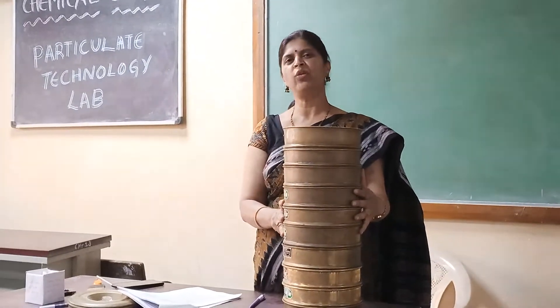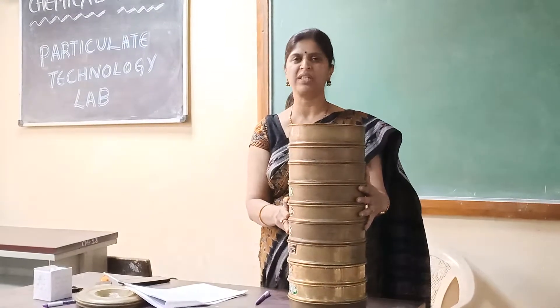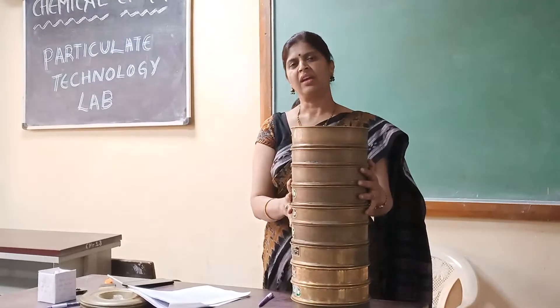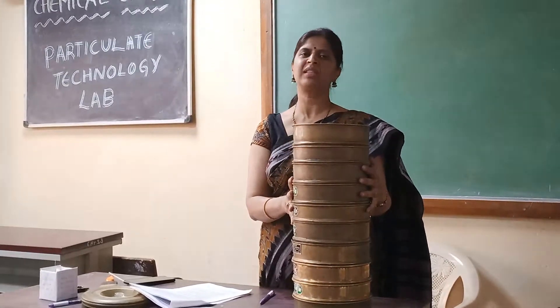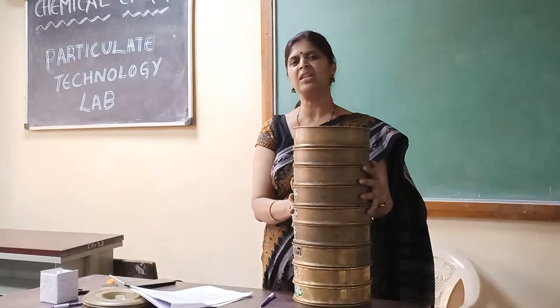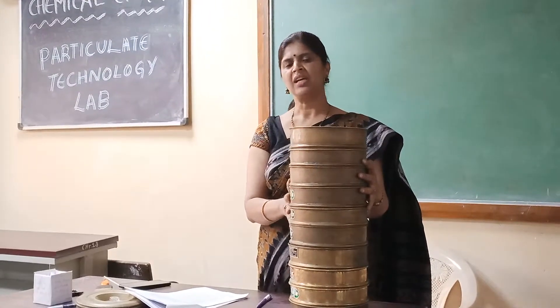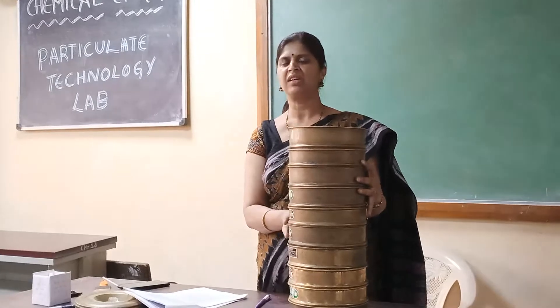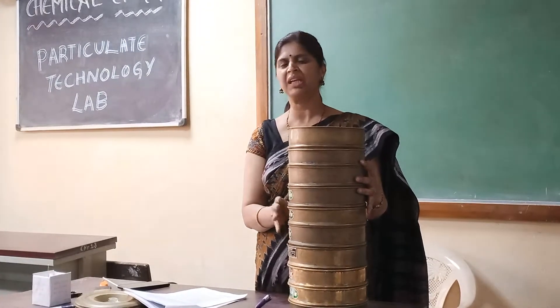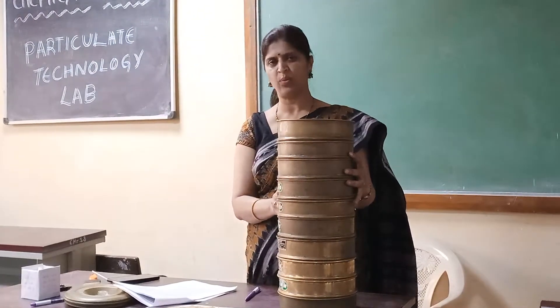You already know from the last session of screen analysis what screen analysis is and what a screen is. The screen is used to separate particles according to their size alone. The particles which have to be separated are put in a set of screens and it is sieved for 10 to 20 minutes. Whatever particles are collected on each surface of the screen are collected and weighed.